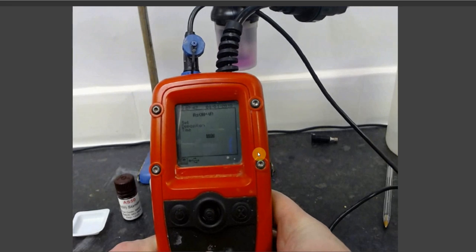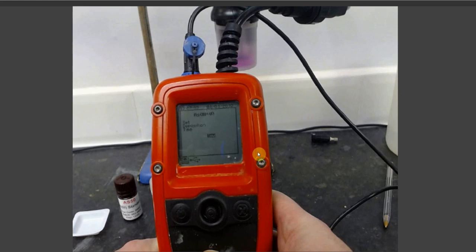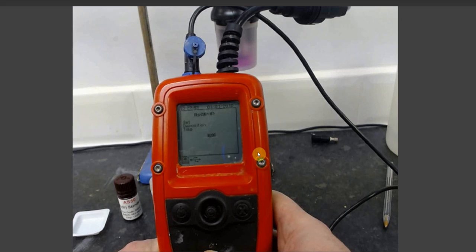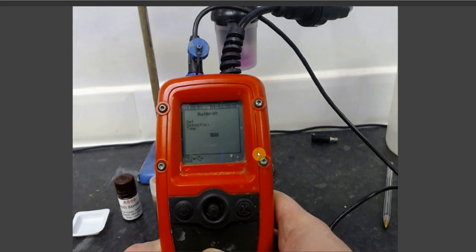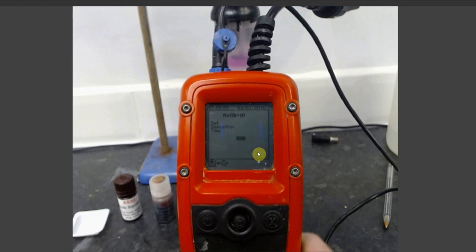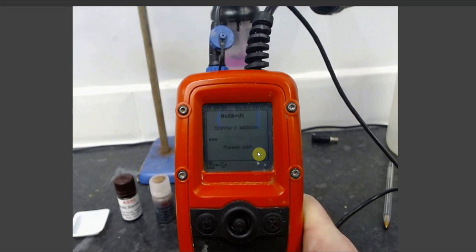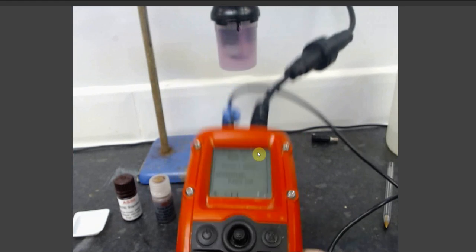The reason you would do this is that you can theoretically change your limits of detection, with halving your deposition time theoretically doubling your upper limit of detection and doubling your deposition time theoretically halving your lower limit of detection. The Metalyser works best with the default deposition time, which covers the ranges quoted in your catalogue. As such, press select and the Metalyser will begin the first analysis to produce the first voltammogram that it requires for a single point standard addition analysis.